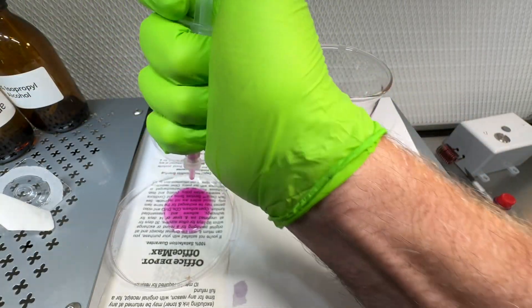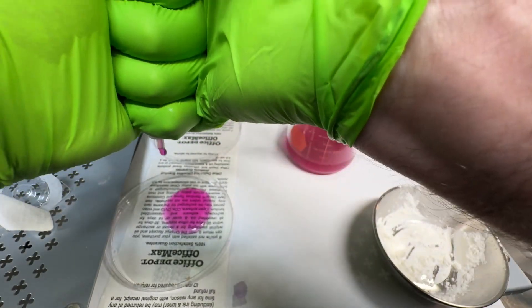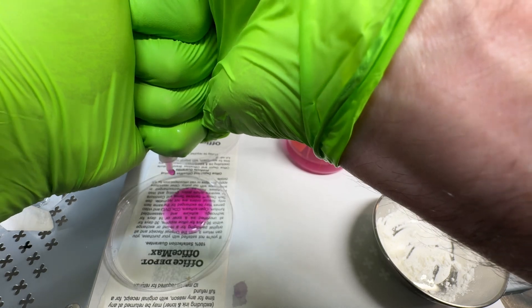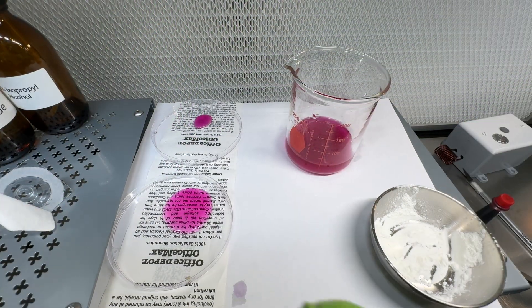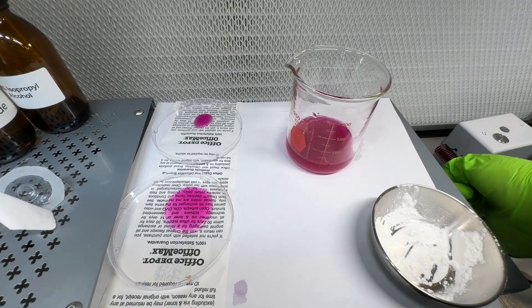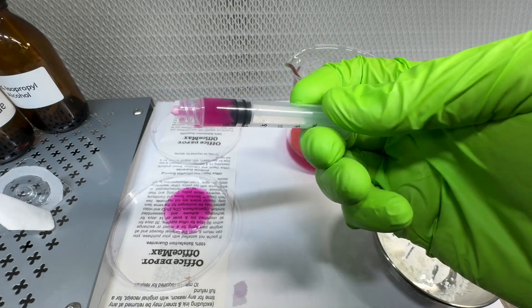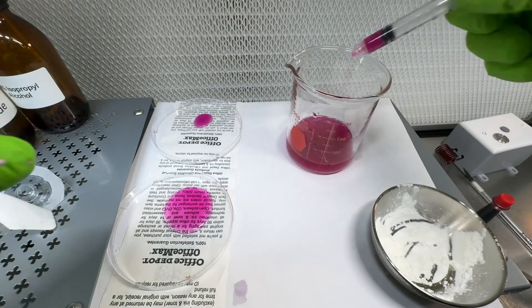The cornstarch does make it tough to push through the filter — it clogs it up pretty quickly. The activated carbon was not that bad, but it will go through, it just takes some effort. That's an indication of the way these filters work. You can see it actually clogged even before it got to the filter, which is why we were having such a hard time.